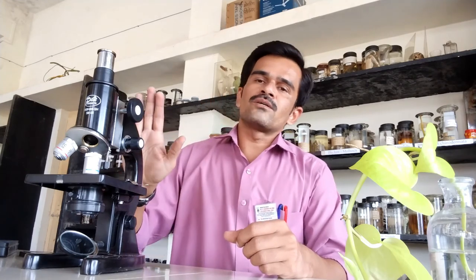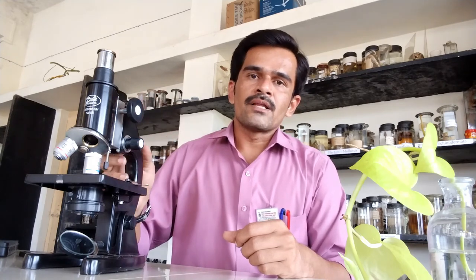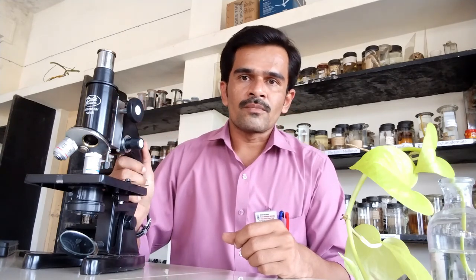So this is the way to see the slide under the light microscope. In this video lecture we have learned how to prepare a slide and how to view a temporary slide under the compound microscope. Thank you.